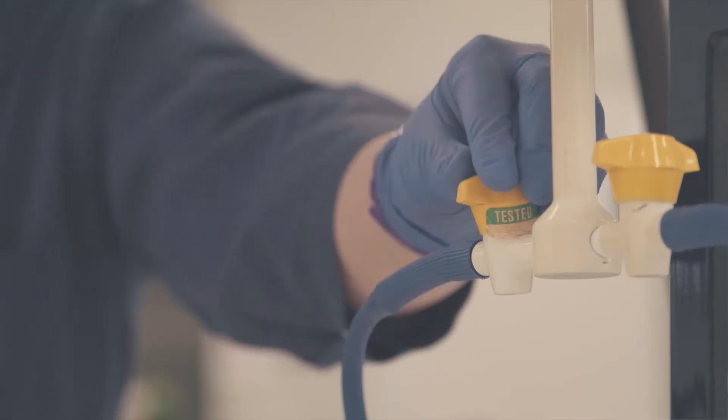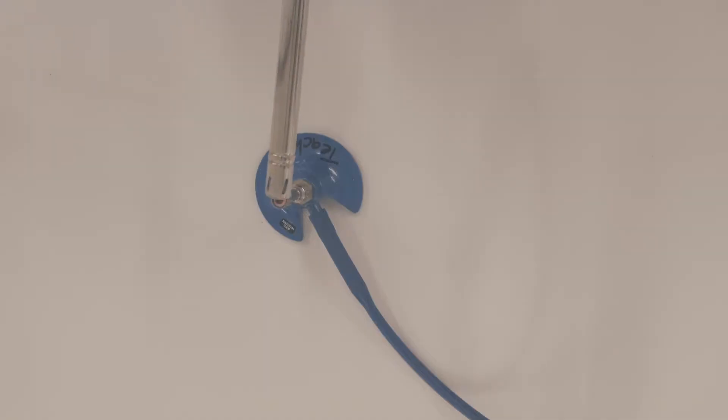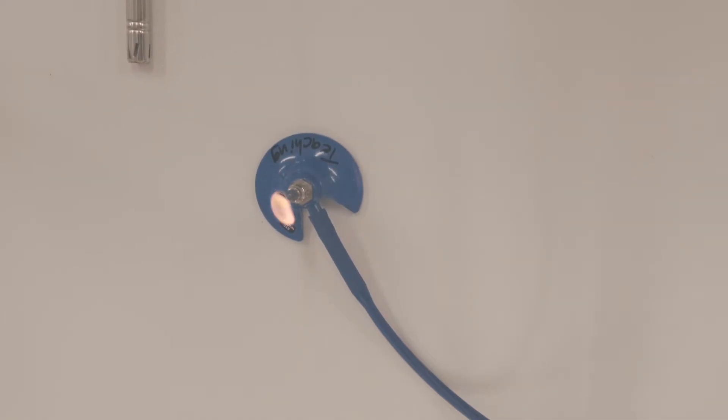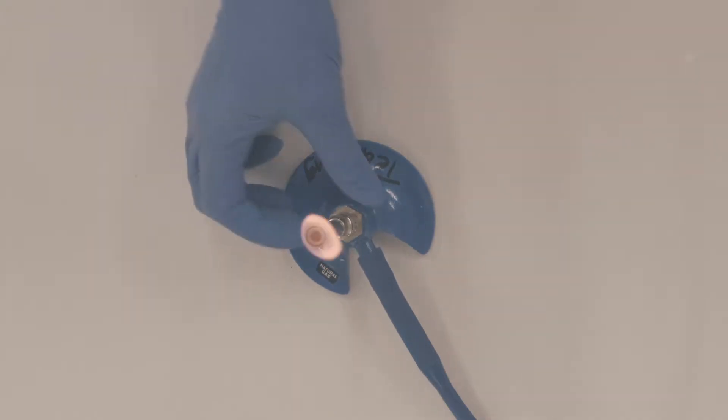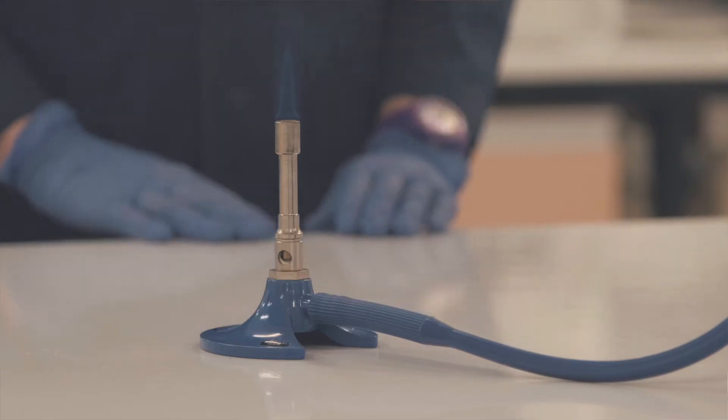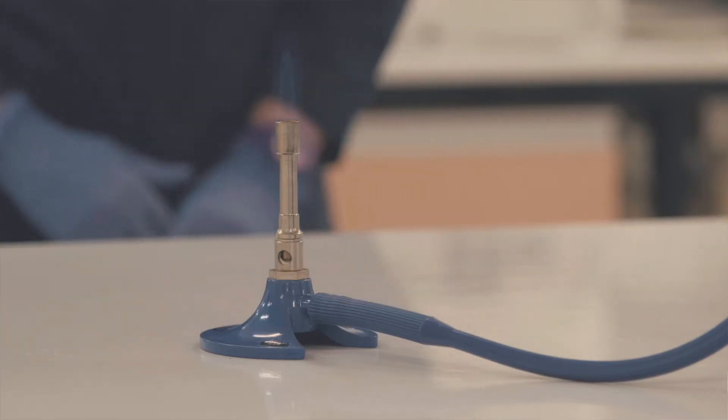Air flow can carry airborne contaminants, but we can deal with this in a few ways. You can light a Bunsen burner and the updraft from the flame creates a relatively sterile area. There is an option to change the flame from orange to blue. The blue flame is much hotter and provides better sterility, though it can be hard to see. Work as close to the flame as possible, but take care not to burn yourself.